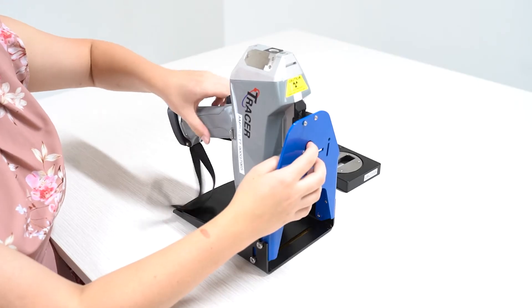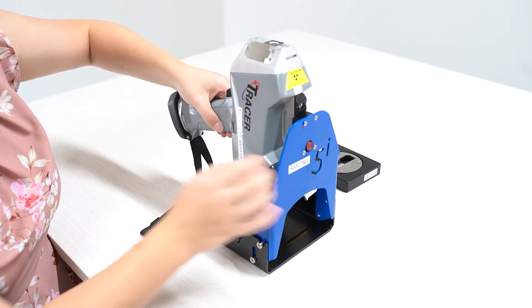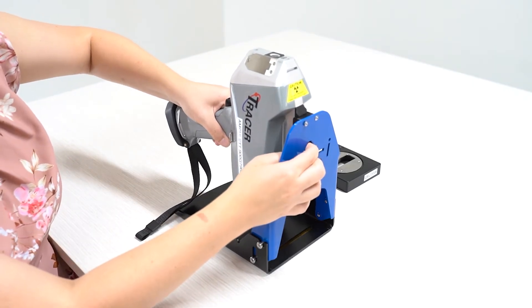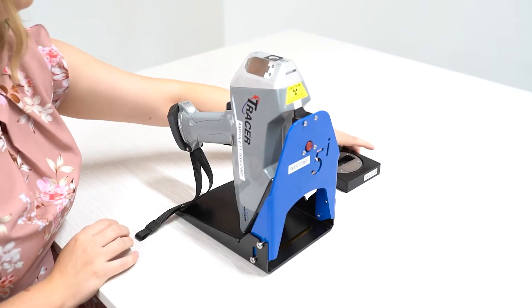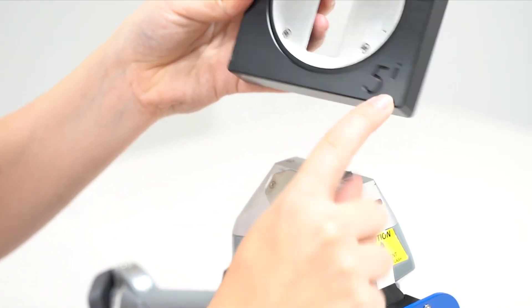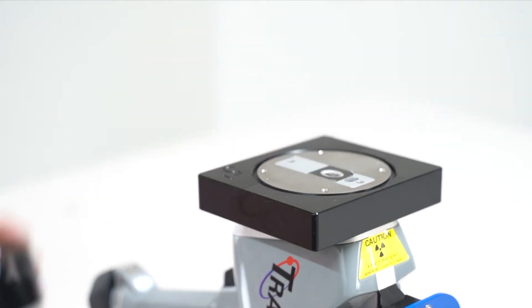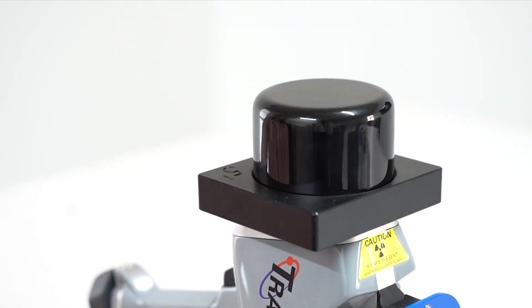From here, if you are unhappy with the position, click the button again and you can move the rail up and down until you find the correct analysis position. Grab the bottom of the lid and make sure the 5i engraving faces the handle. Grab the top of the lid and place it on top. Now you're ready for analysis.